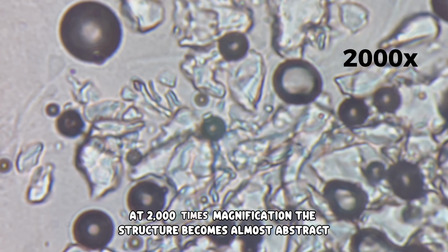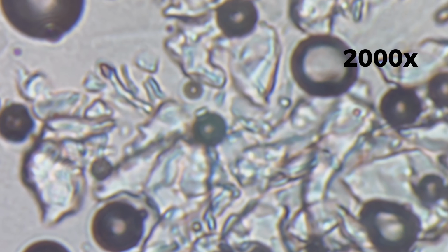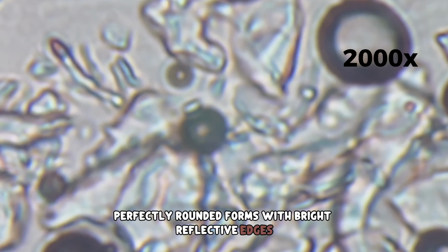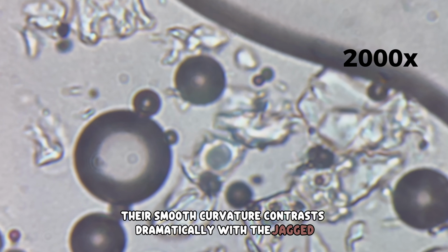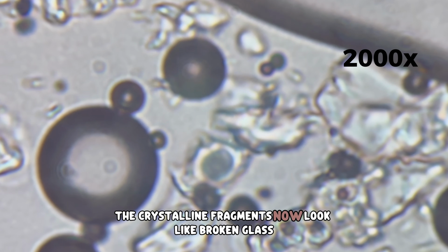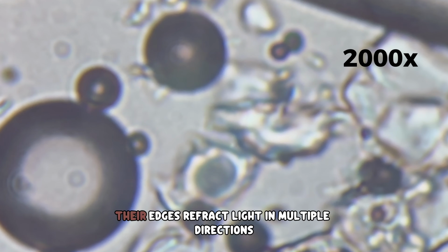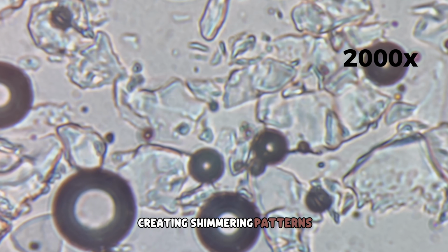At 2,000 times magnification, the structure becomes almost abstract. Large air bubbles appear as dark, perfectly rounded forms with bright reflective edges. Their smooth curvature contrasts dramatically with the jagged sugar crystals surrounding them. The crystalline fragments now look like broken glass, sharp, irregular, and densely packed. Their edges refract light in multiple directions, creating shimmering patterns.